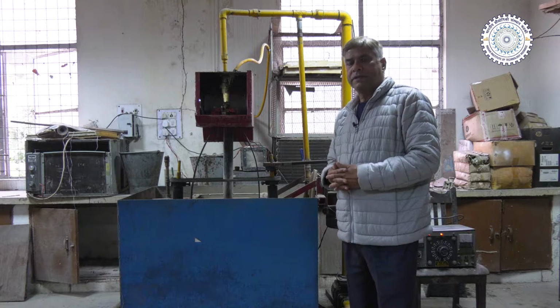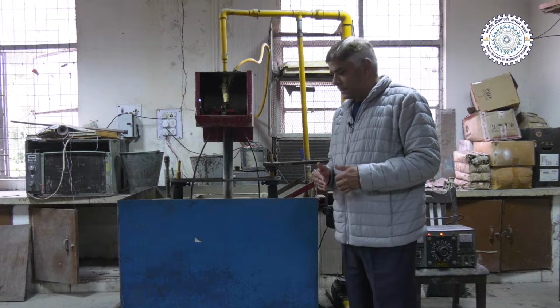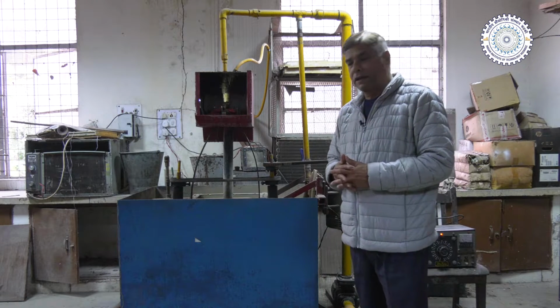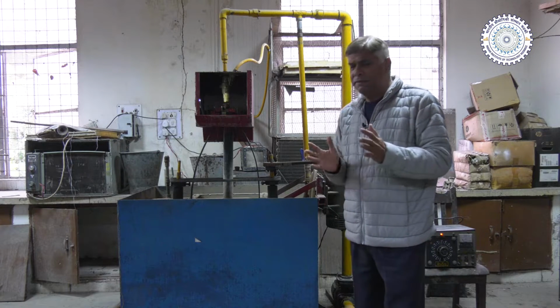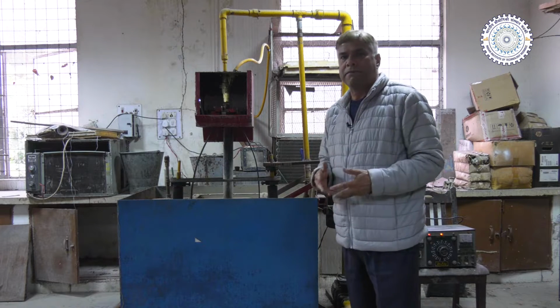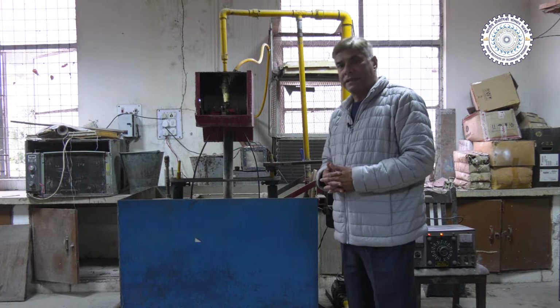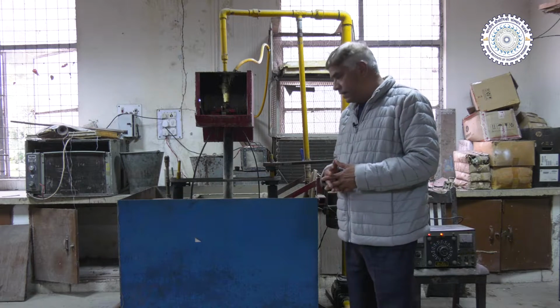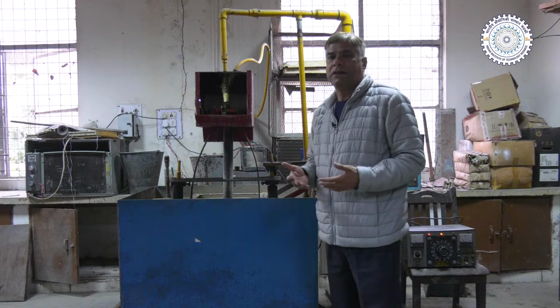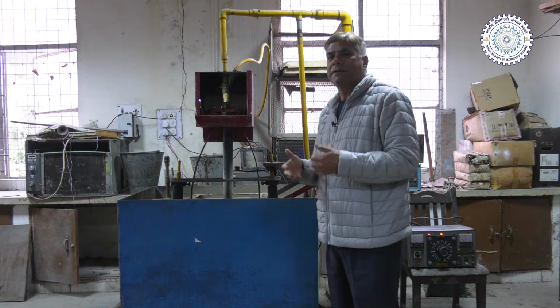So, a better way of slurry erosion test has also been devised over the years, and that is called slurry jet erosion test. So, in that case, we prepare a slurry of the suitable material. Slurry means it is having some suitable solution, which is mostly in form of the water, and sand particles, or it can be anything else against which the slurry erosion test is to be conducted. So here in this case, this is a big tank which is having the slurry of the water and the sand particles. So sand particles of the different sizes in different proportions, they are mixed and dissolved.